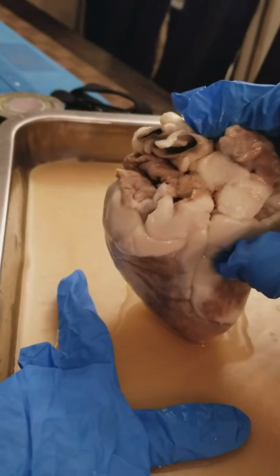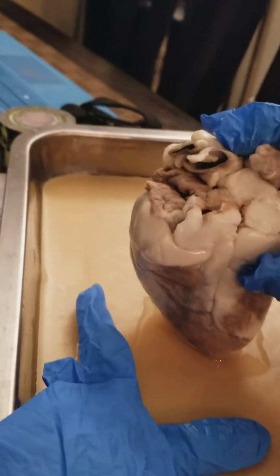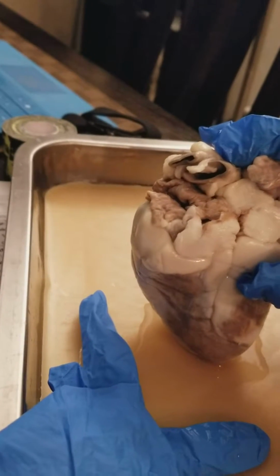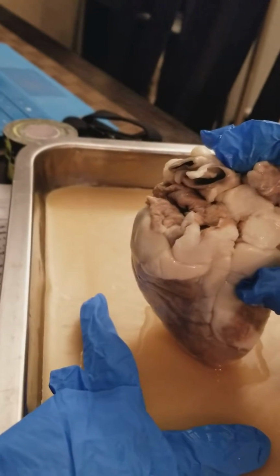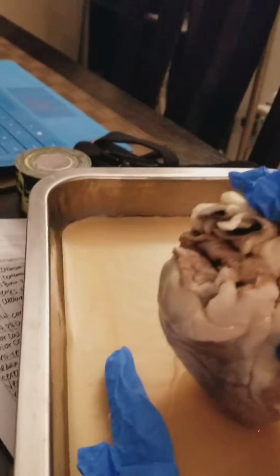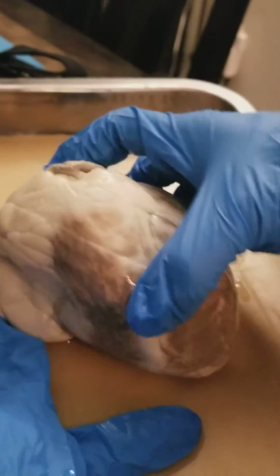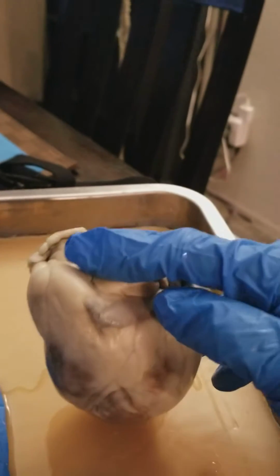And the left ventricle receives oxygenated blood and pumps it through the aorta. The pulmonary trunk basically transmits oxygen-depleted, carbon dioxide-rich blood from the right ventricle to the lungs. So the pulmonary trunk is actually around this area.